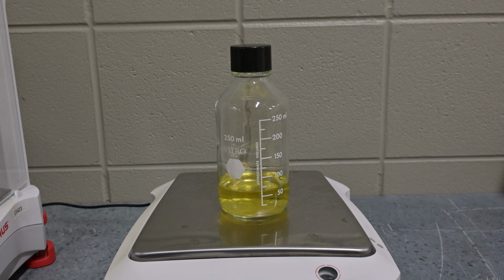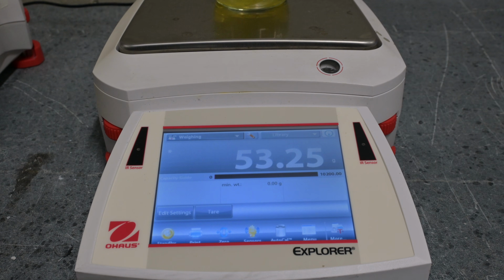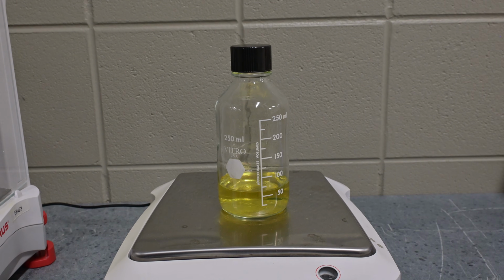After purification, I ended up with about 53.25 grams of butyl nitrite, about 62% of the theoretical yield based on the starting materials. We can estimate the theoretical yield either by comparing smaller and larger runs, or by calculating how much nitrous acid can form to esterify the N-butyl alcohol.